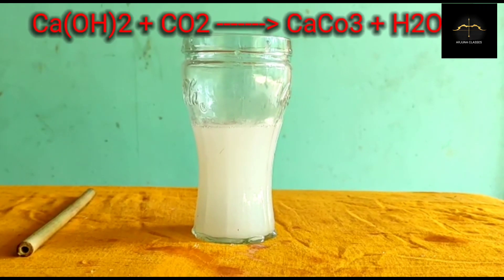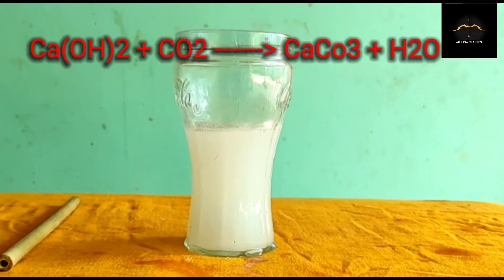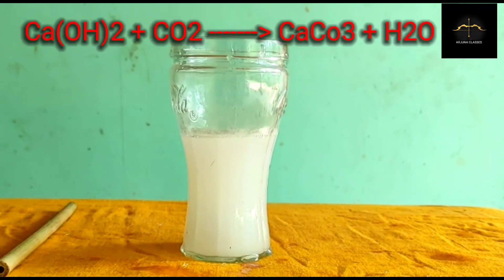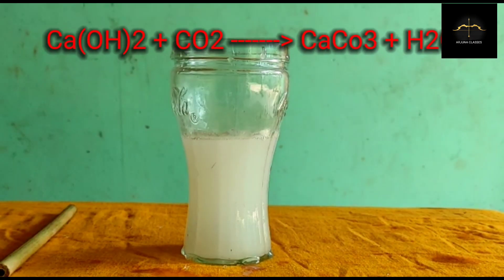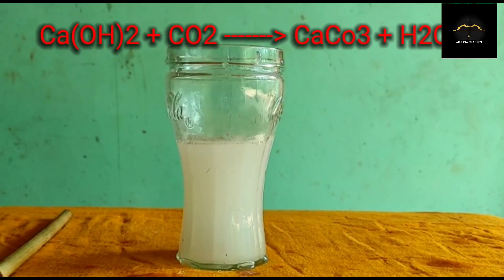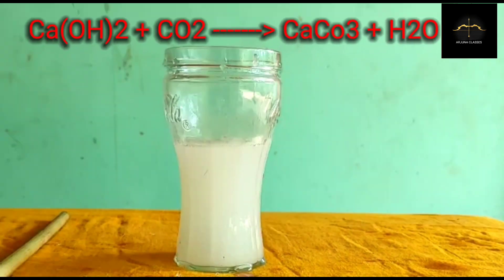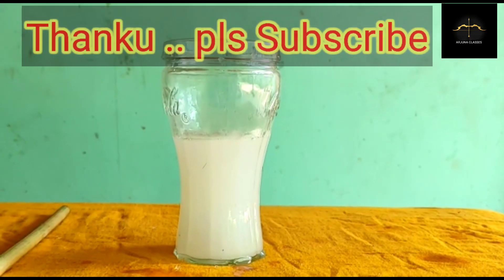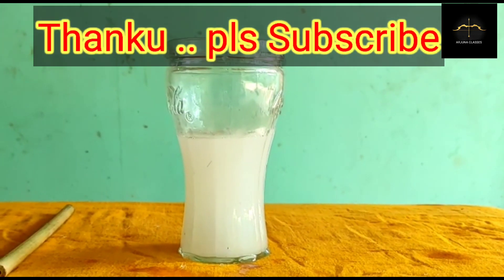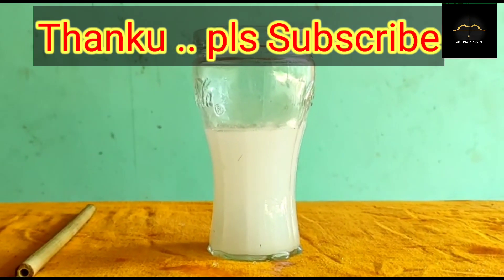This is because when exhaled air is blown through lime water, which is known as calcium hydroxide, the carbon dioxide present in the exhaled air reacts with the lime water and turns it into a milky solution. Since CO₂ reacts with Ca(OH)₂ and forms CaCO₃, or calcium carbonate, which is insoluble and white in color. Thank you.